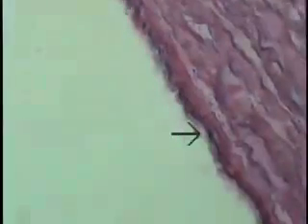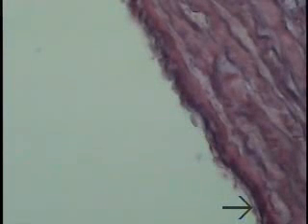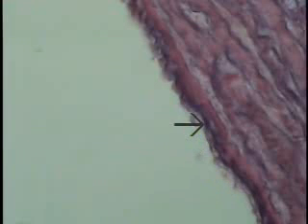And finally, we get to the lumen. One can make out the endothelial lining, and the tunica intima extends to about this level, so it's relatively thin. Obviously, the dominant feature of the wall of the elastic or conducting arteries is the elastic laminae. This is why they are called elastic arteries, because of this very dominant feature in the media of the wall of this particular blood vessel.